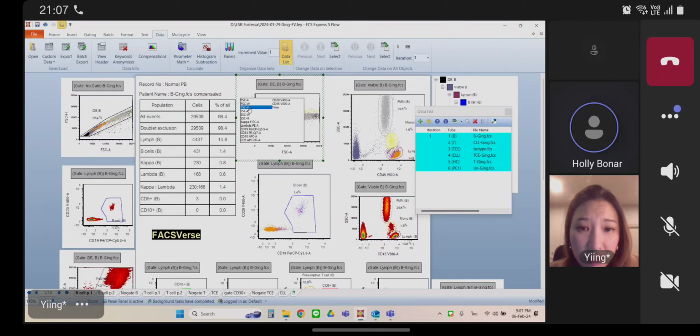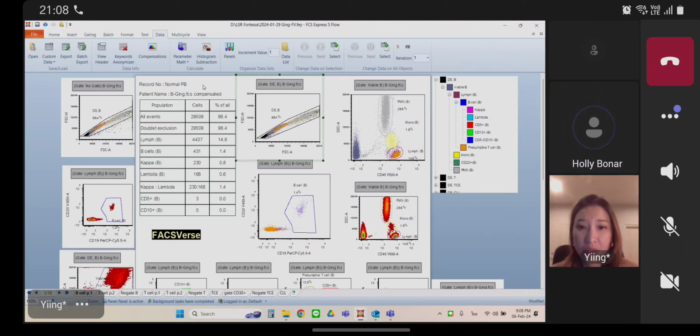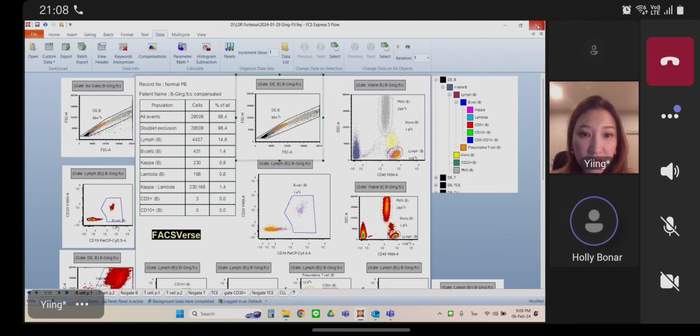Yeah. Okay. So there's 1, 2. Okay. So you can see right here, there's 6 parameters, right? So forward scatter, area, width, height, and then side scatter, area, width, height, and then kappa lambda, right? So kappa is the 7th parameter in this layout. Okay. So let's close this one. Let's go back to your LSR layout because that's the one that's causing problems. Back to LSR template, no? Yep.